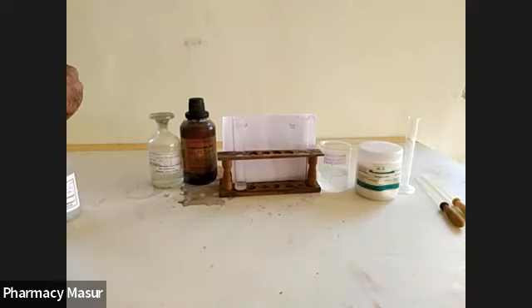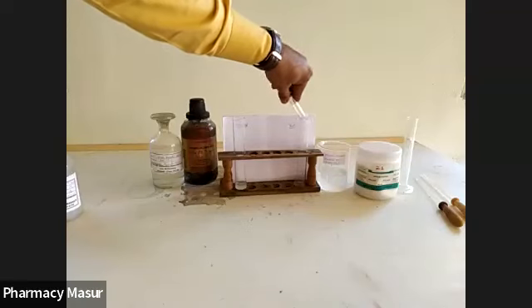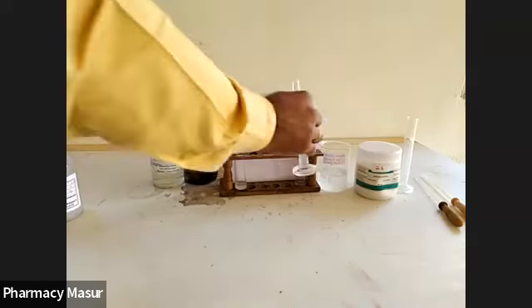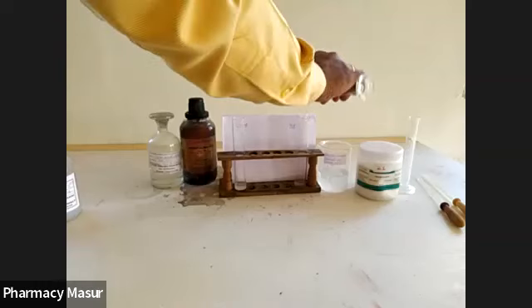It should be mixed and stand for 1 minute. Simultaneously, 1 ml solution of barium chloride should be added in the test sample. This is a Nessler's tube labeled as test. Then after that, 1.5 ml of ethanolic sulfate solution. And keep this test aside for 1 minute.